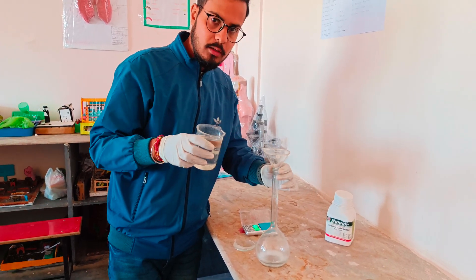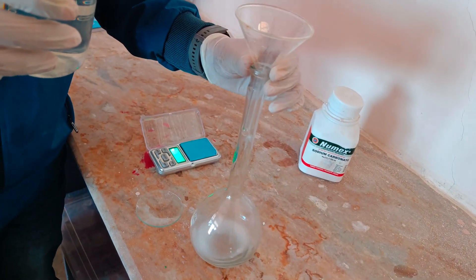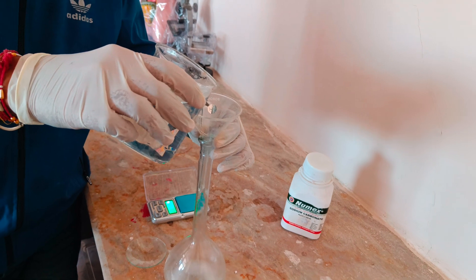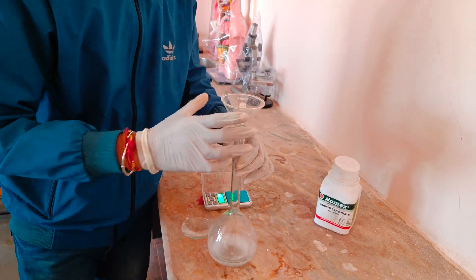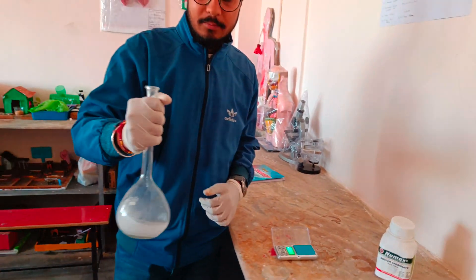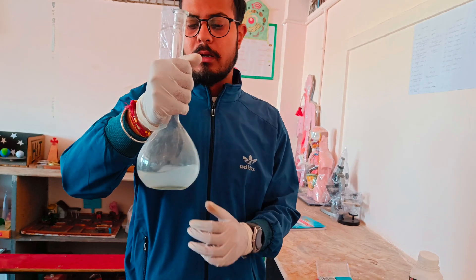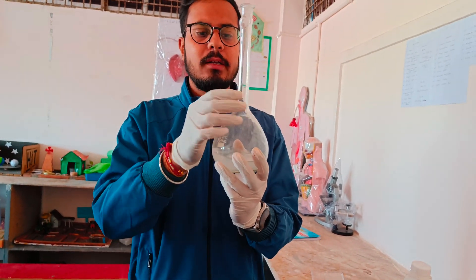As you can see, the whole of the crystals are gone inside the measuring flask. Now we will add some amount of water so that it can mix with the water thoroughly. Now we will shake it till it is completely dissolved. The crystals of sodium carbonate are completely dissolved in water.